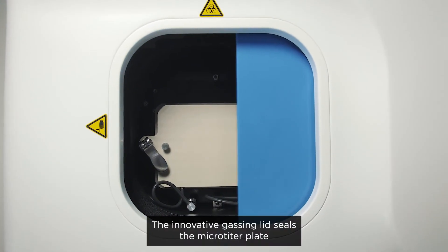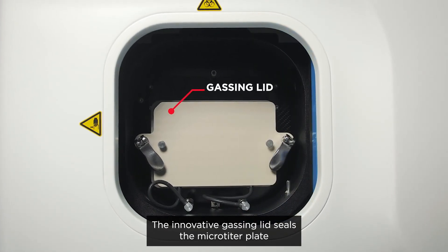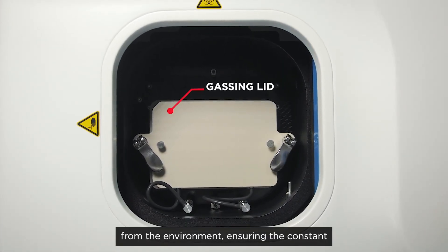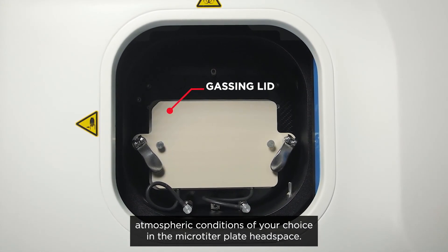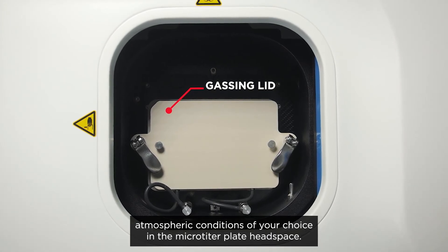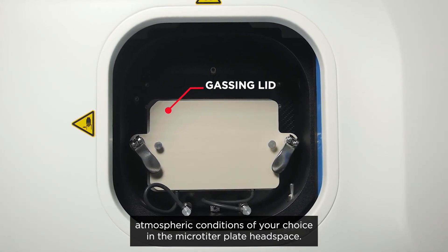The innovative gassing lid seals the microtiter plate from the environment, ensuring the constant atmospheric conditions of your choice in the microtiter plate headspace.